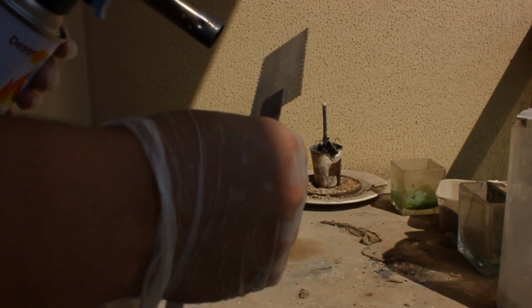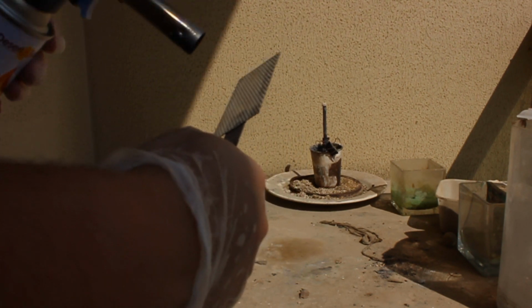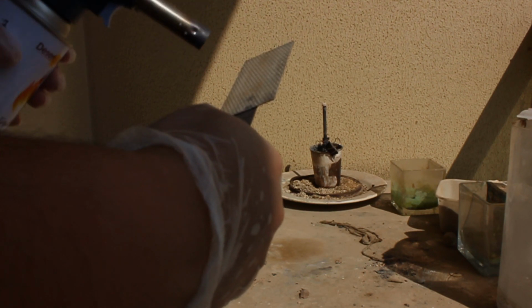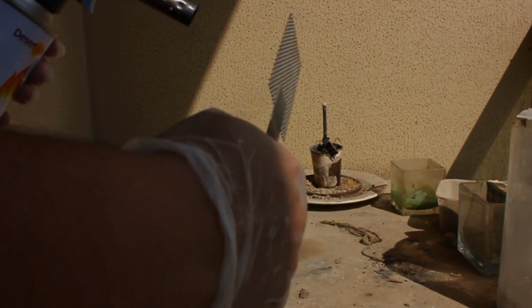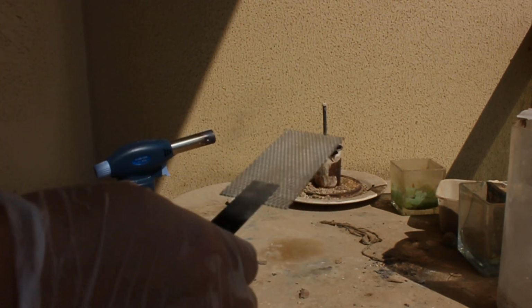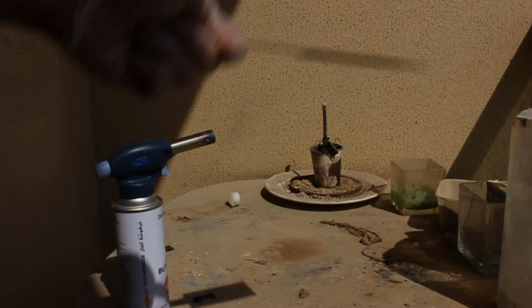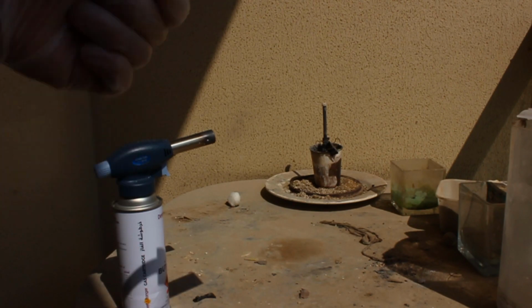We bake until we see that nice grayish color. Yep, getting there. Not too hard. Too hard means you failed. You don't want to fail. The handle's starting to get hot, but that doesn't matter. We're starting to see our nice yellowy gray color. Shake it around. And I'm going to continue this, and I'm going to show you what the final result looks like.